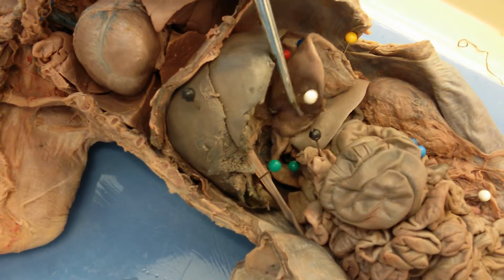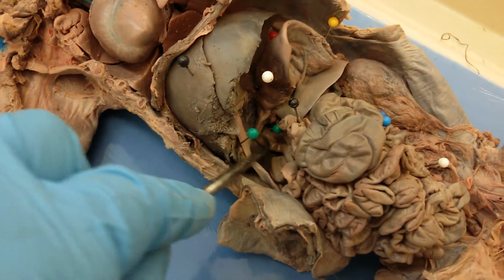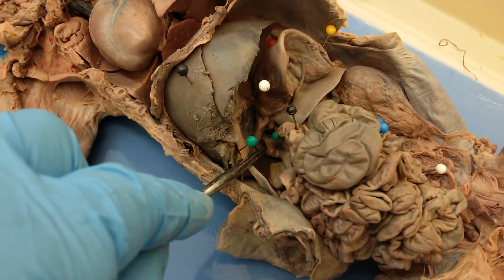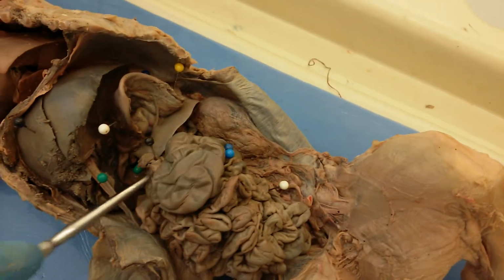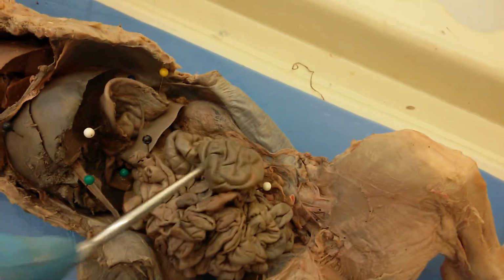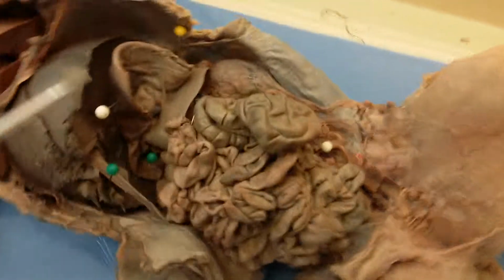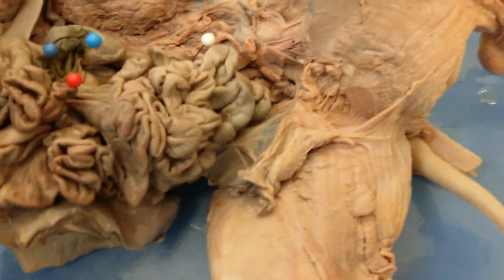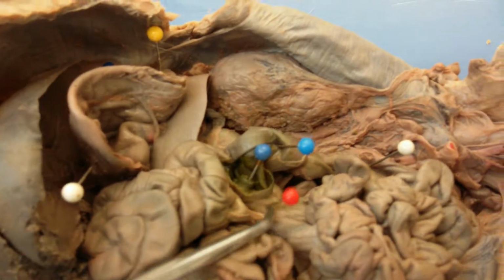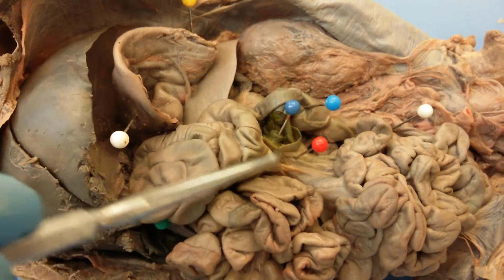This is the pyloric part, the pylorus, and then over here is the beginning of the small intestine. So this is the duodenum of the small intestine. And then the jejunum of the small intestine is actually the majority of it. And so this will be all of this. And then finally, the small intestine will actually be leading into the large intestine. So right here is the ileum. So this is the terminal part of the small intestine.